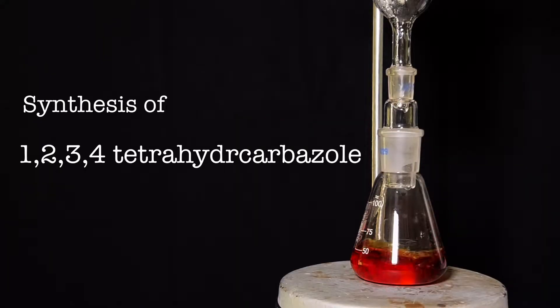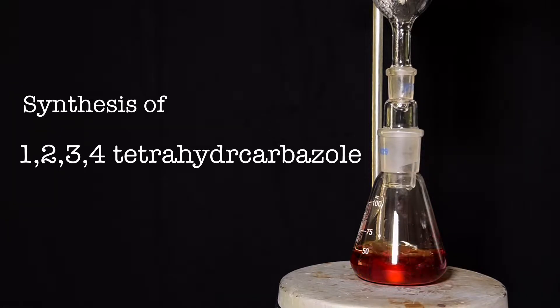Hello friends, in this video we will be synthesizing 1,2,3,4-tetrahydrocarbazole from cyclohexanone.